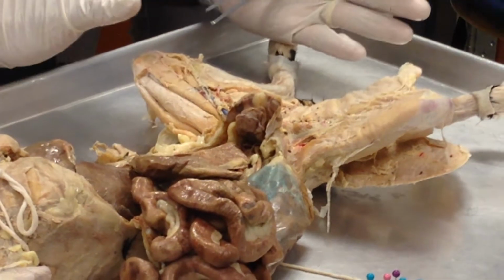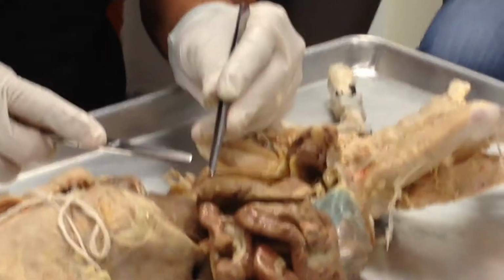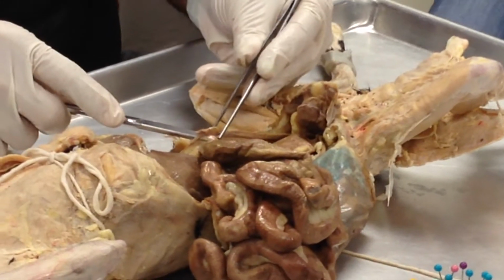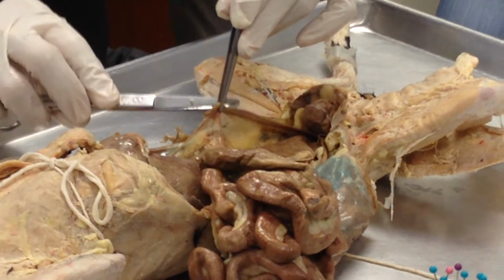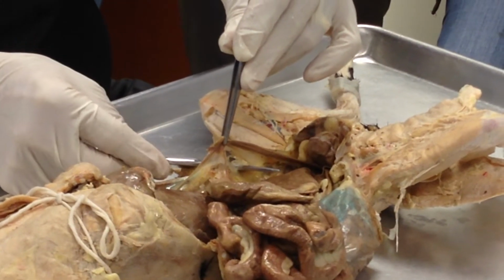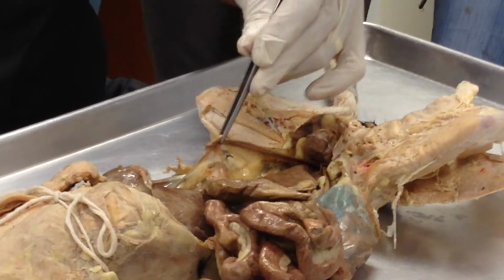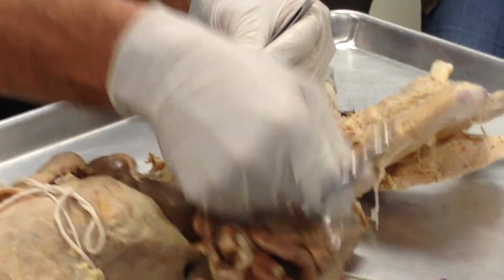People, female, cat and human, a lot of differences. We'll start off first here with the ovary right there. So there's the ovary on the left hand side. There we see the broad ligament. That's the broad ligament, and notice it is not a ligament. Membrane, misnamed. Right, so there's the ovary there, and there's the ovary there.